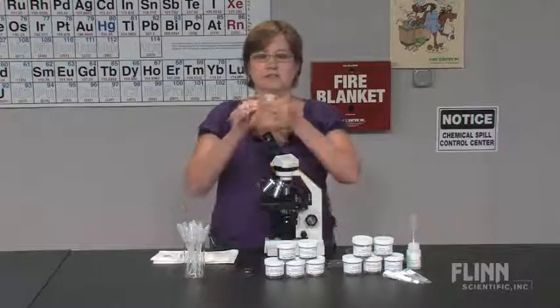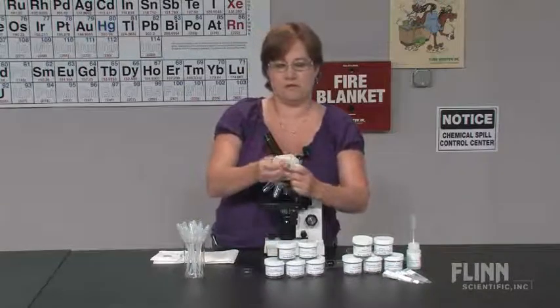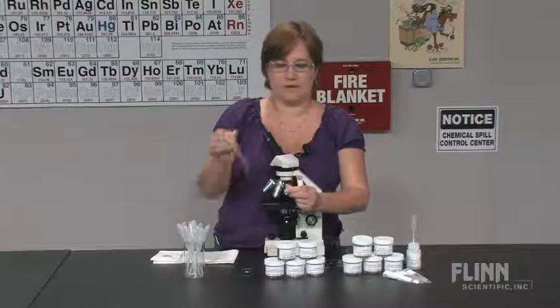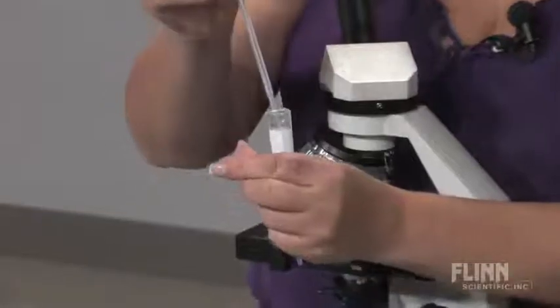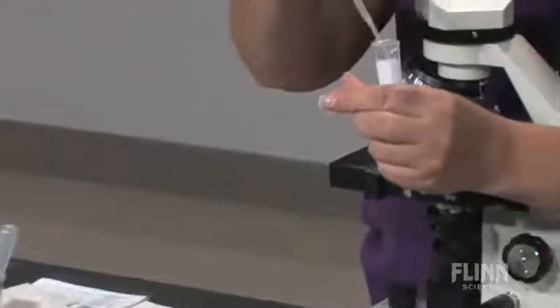Then, simply take the top off and use a pipette so students can take a sample to look at themselves.